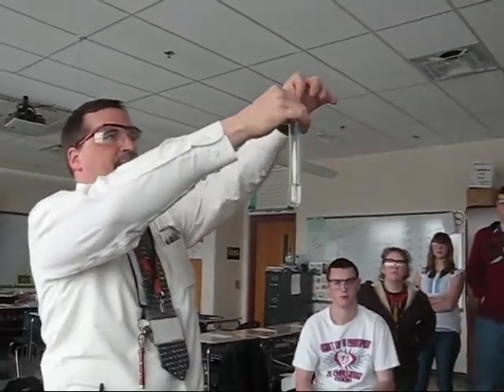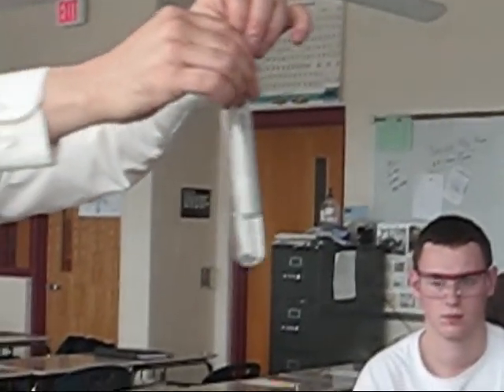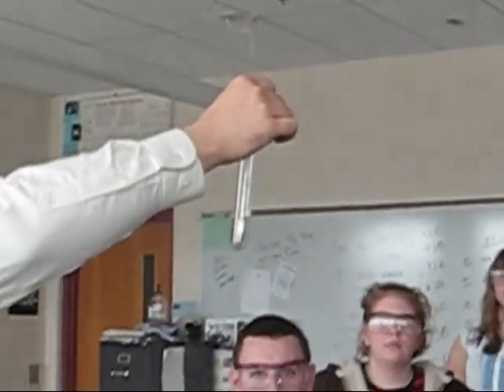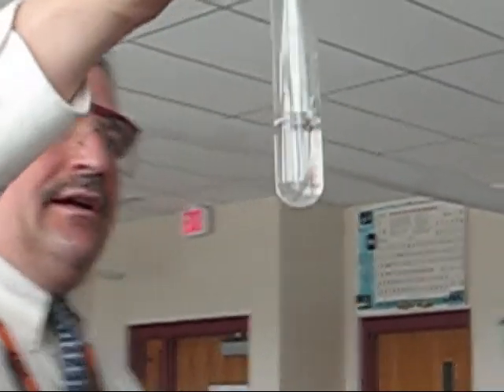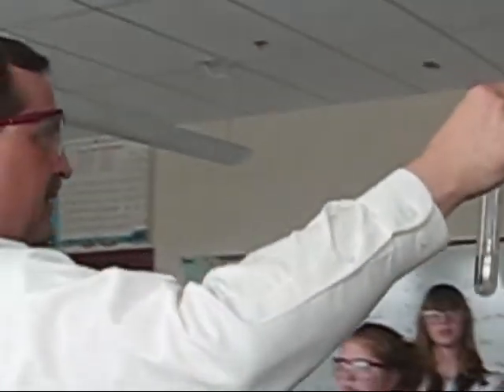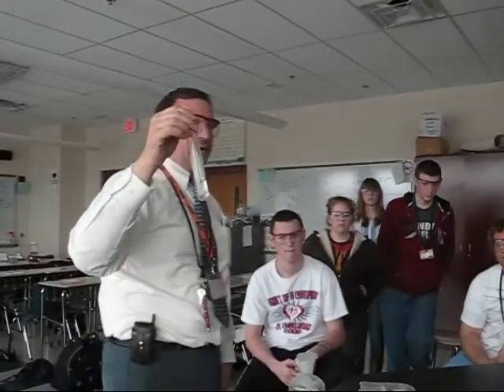This is just pure water. We're going to put a strip of magnesium in. Everybody got the glasses on? Do you see a violent reaction? No. Did you see the bubbles that we saw yesterday? No. Do you see the formation of a cloudy material? No. Magnesium is very slow to react with water.